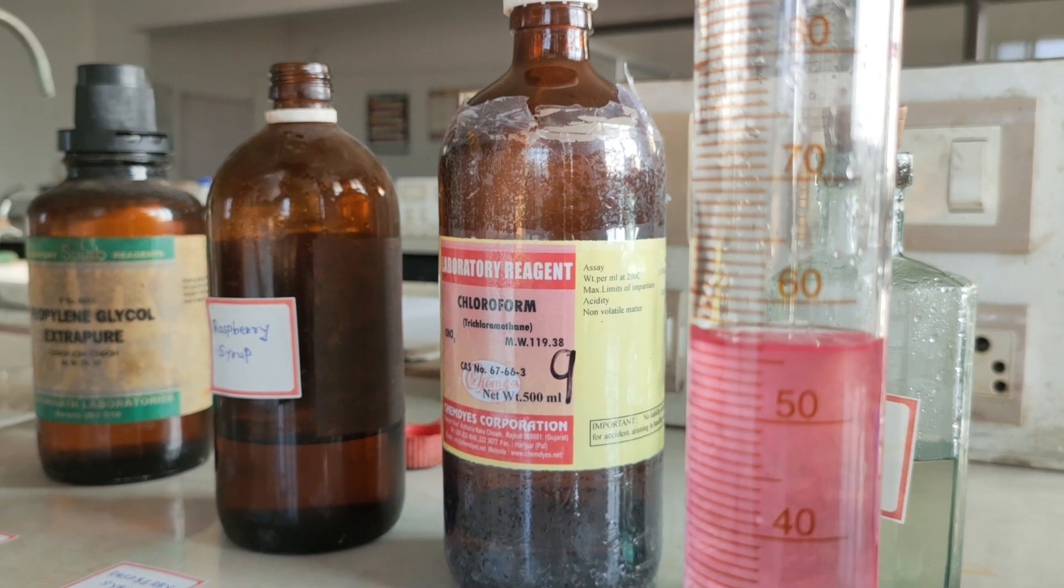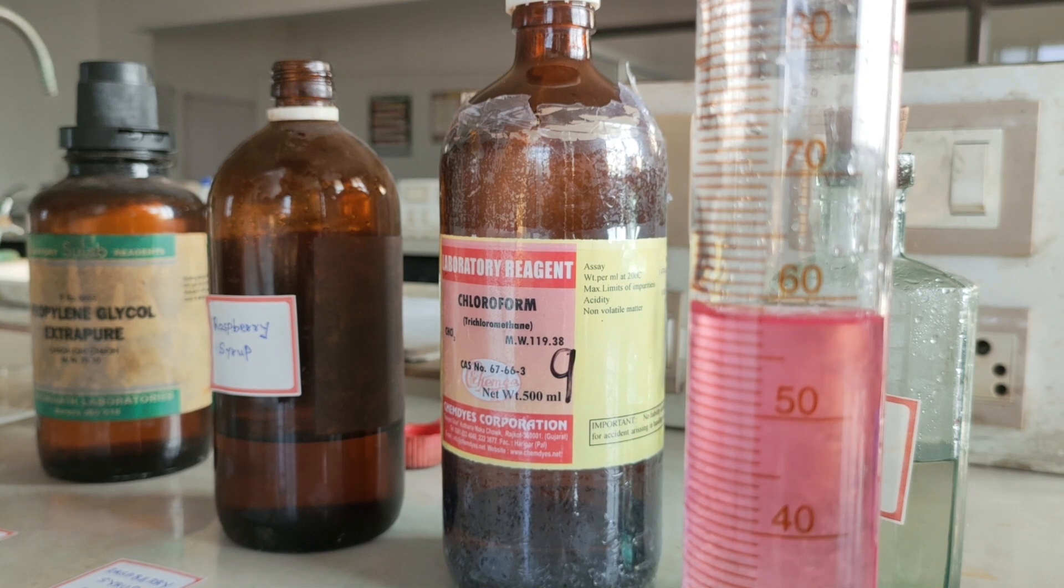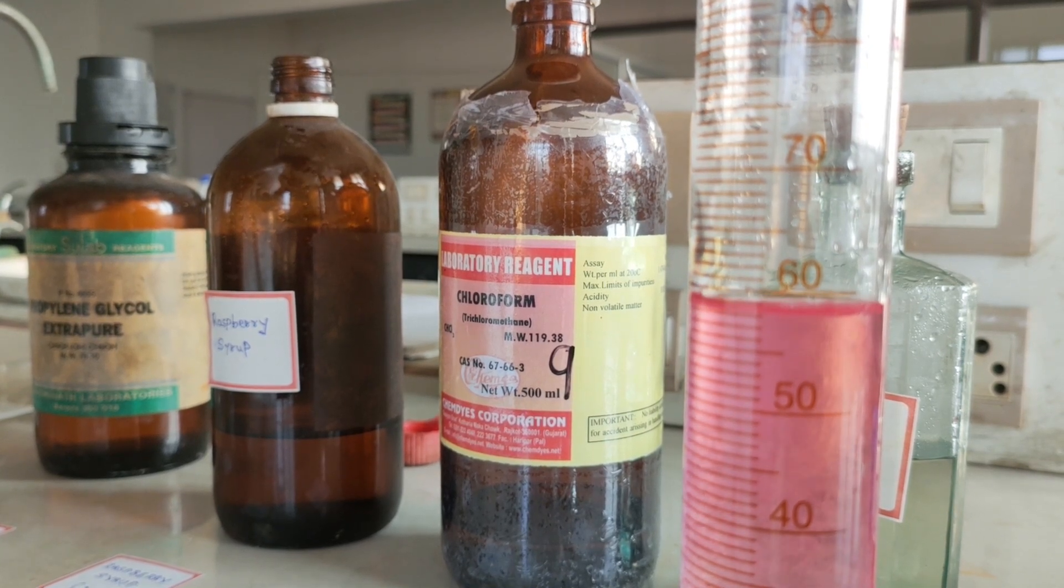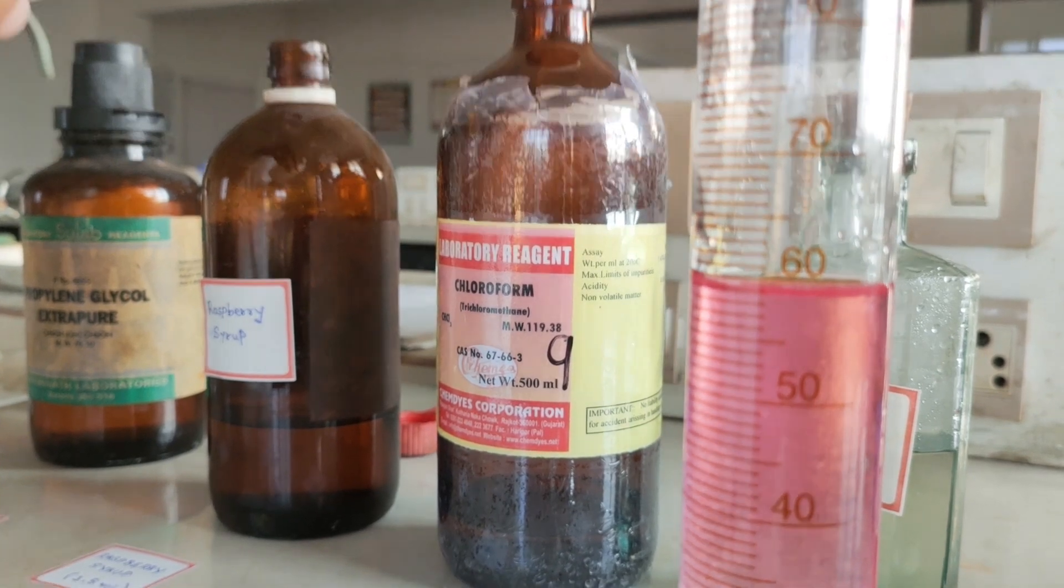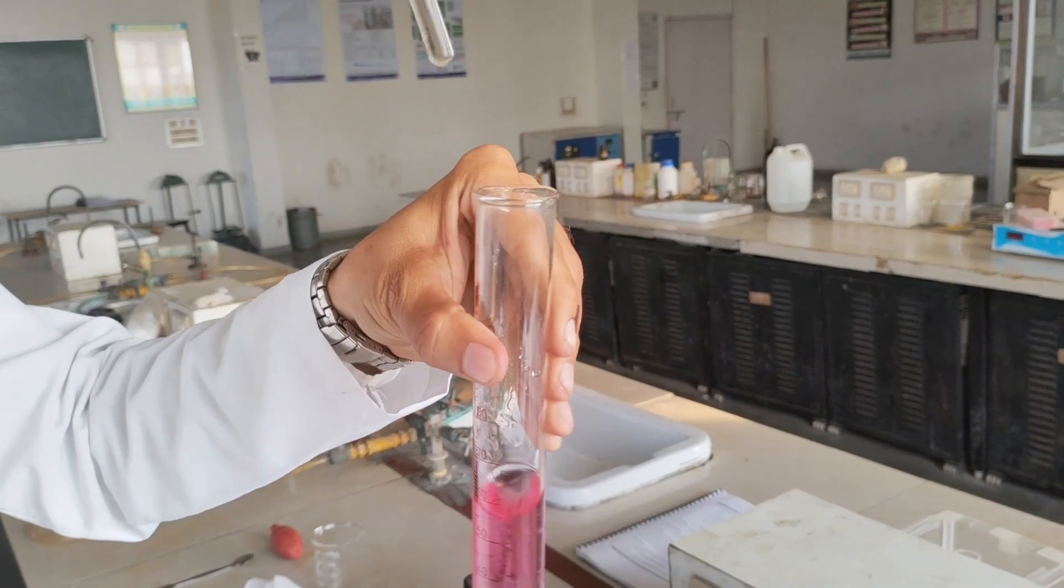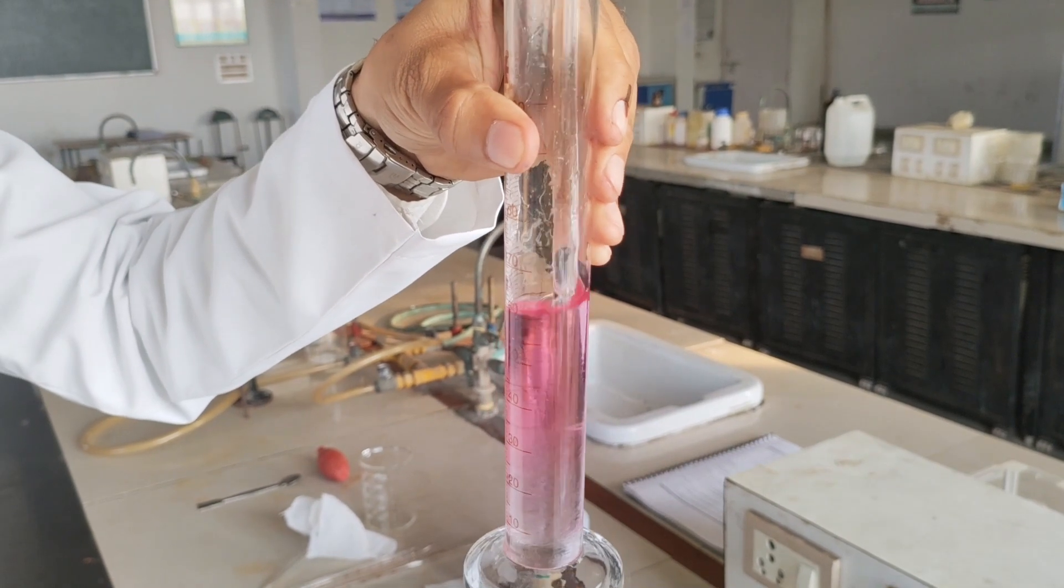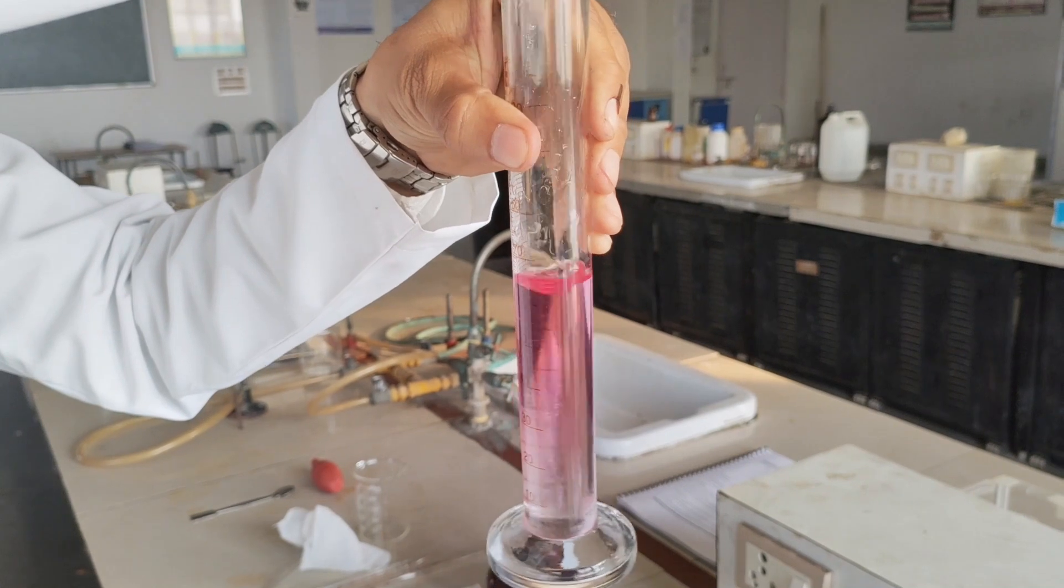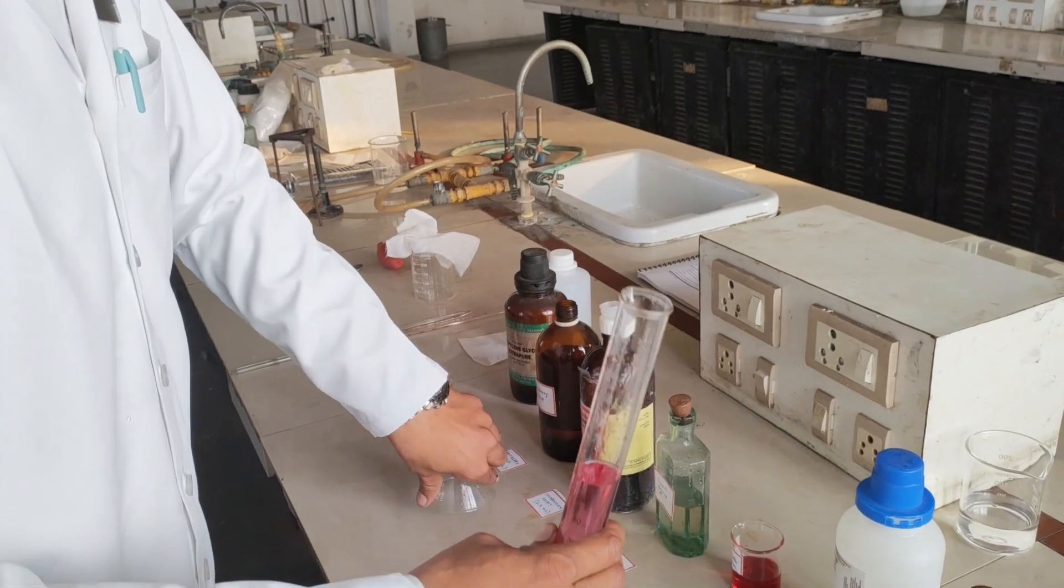Shake it well to mix the entire formulation. We can use the glass rod to mix this formulation completely. Now we are going to fill into the final container, this is our dispensing bottle.